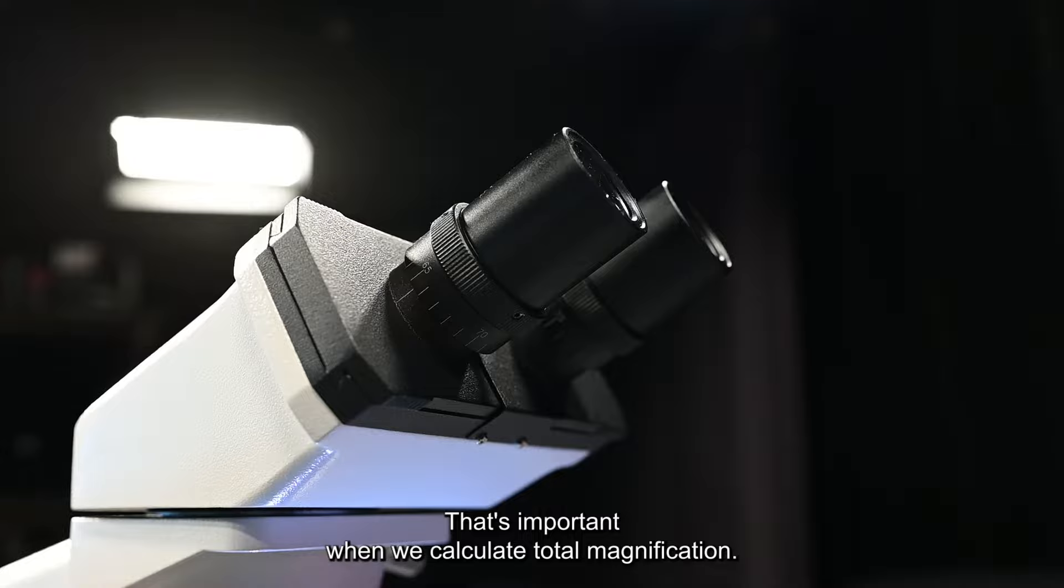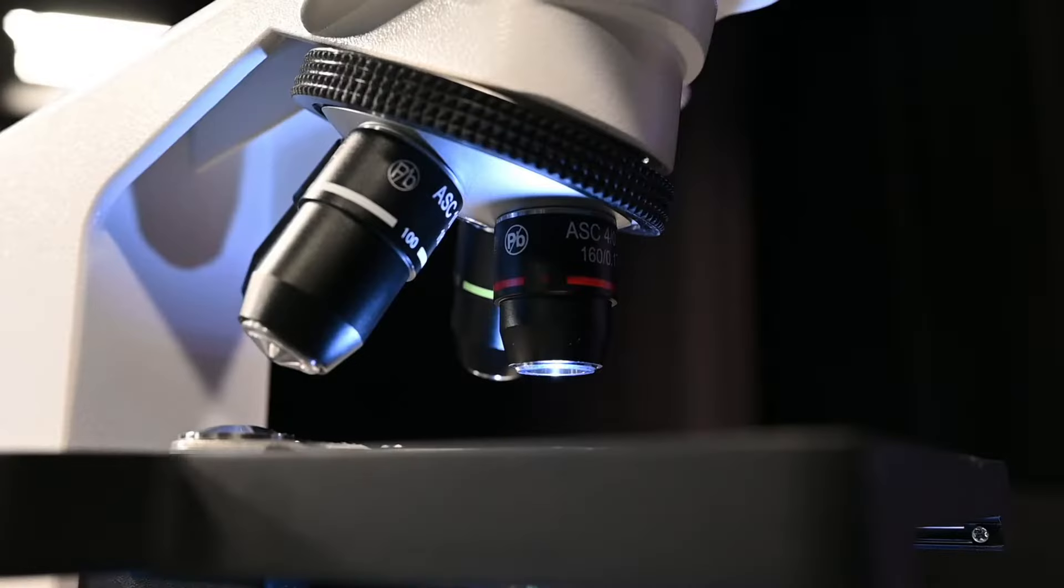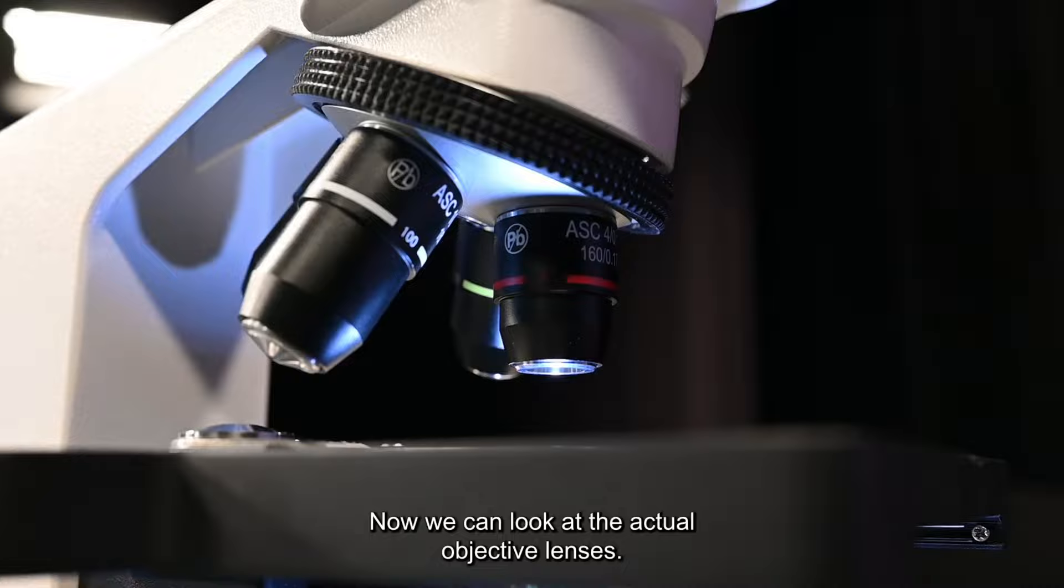Each of these eyepiece lenses has a magnification of ten times. That's important when we calculate total magnification.